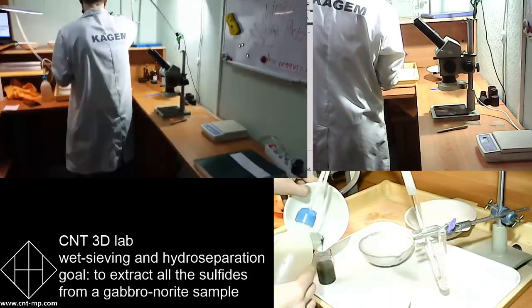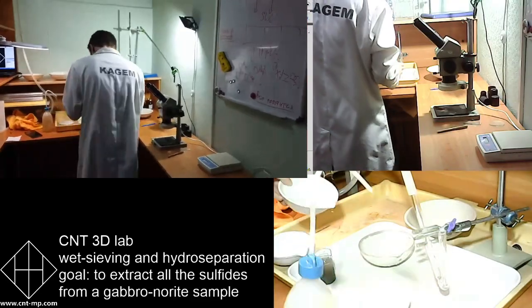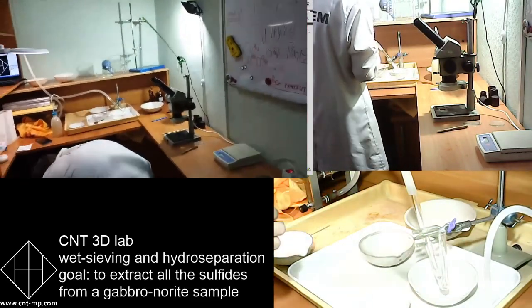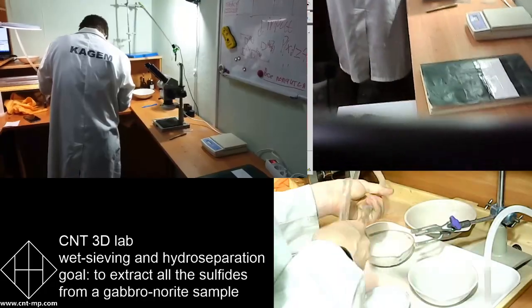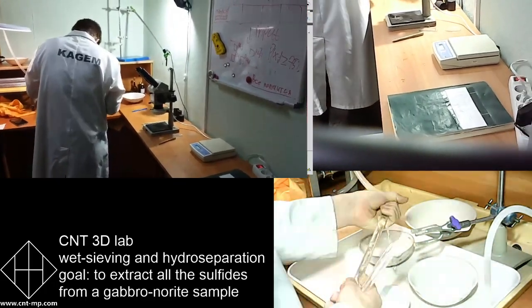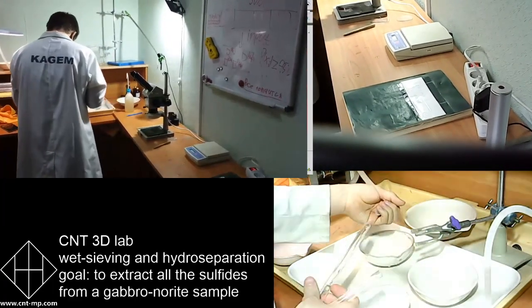They can be measured by mesh size, they can be measured by microns, but they are standard. So whenever you have the column, you can use the same approach. Putting the sieve size on the bucket and just sieve it through using the water and your hands manually.